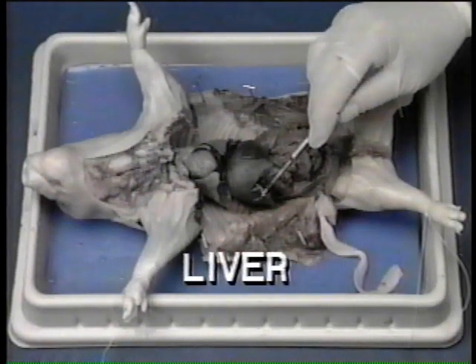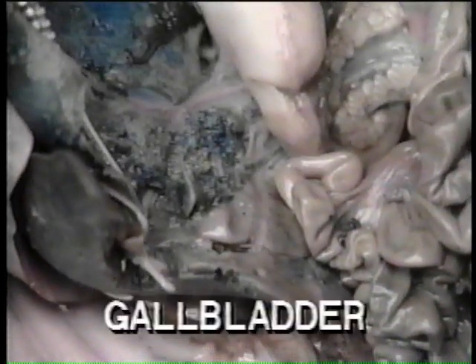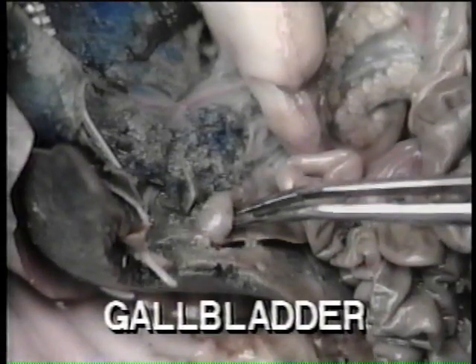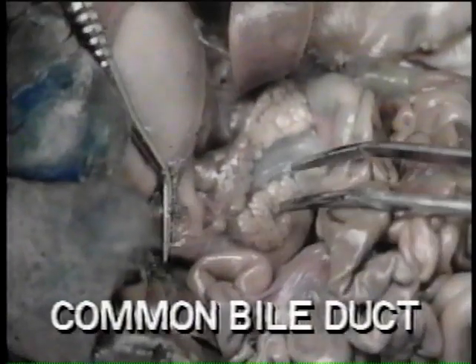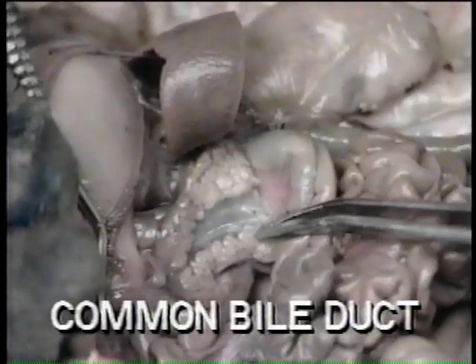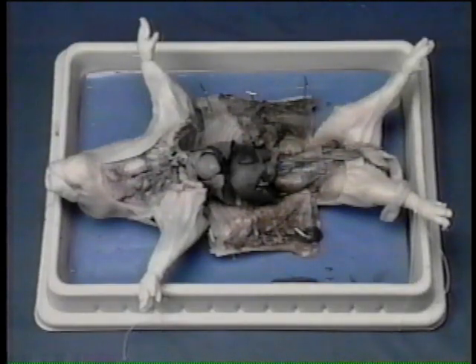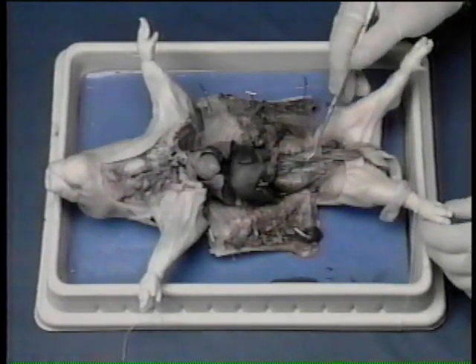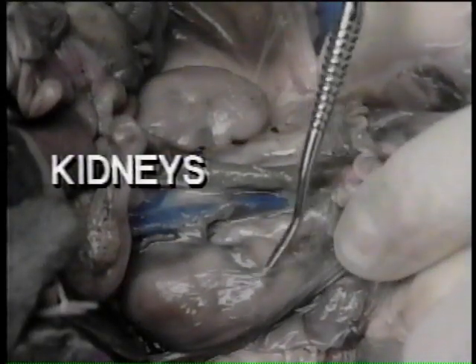The liver, the large gland, is divided into four main lobes. The gallbladder acts as a storage sac for bile secreted by the liver. Trace the common bile duct from the liver to the duodenum. A pair of kidneys is found against the dorsal body wall. They're covered by a smooth, shiny membrane called the peritoneum. This must be removed to see the kidneys clearly.